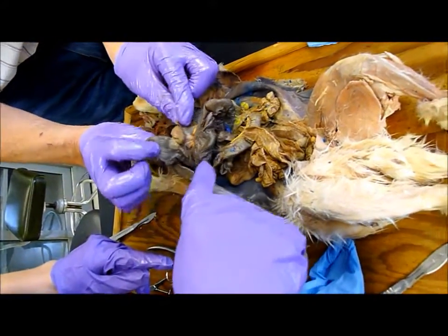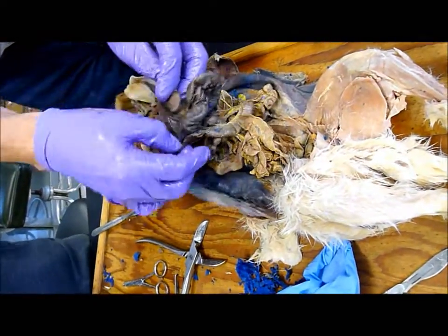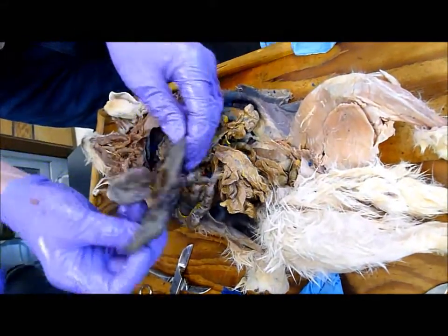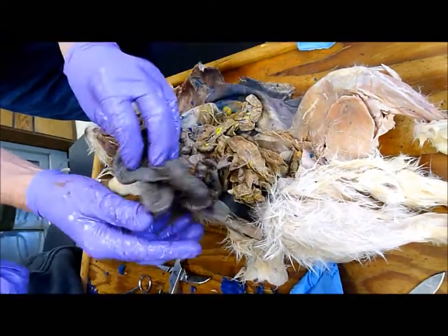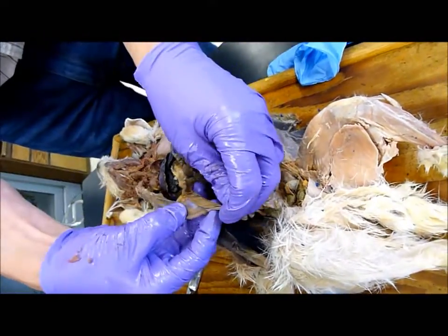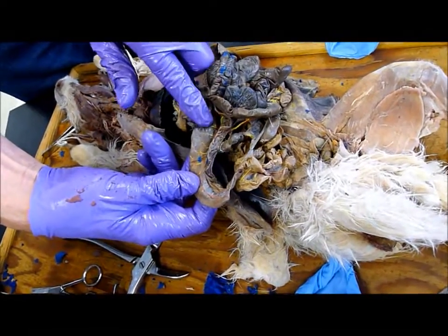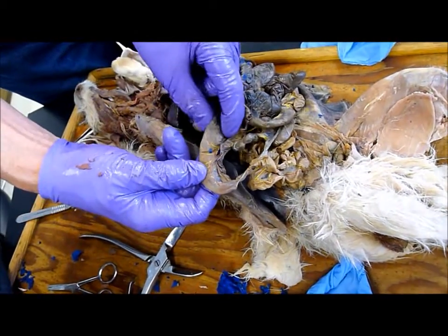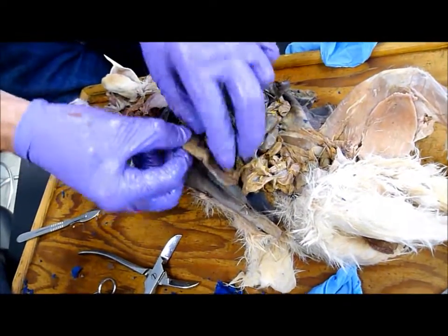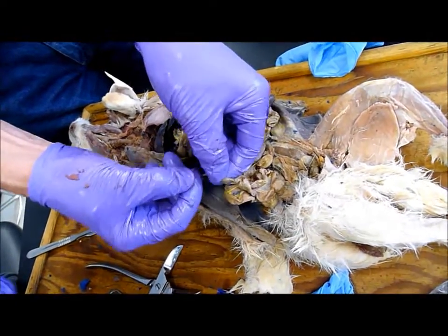There's the ileum, and this would be the cecum. It goes ascending, and the cecum ends in an appendix — the vermiform appendix; vermiform means worm-like. There's the appendix right there. See where it changes color? It's green there and kind of brown — so that's the appendix, and this is the cecum. Is our appendix that long? Ours is much smaller than that.